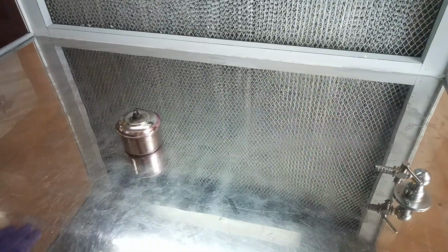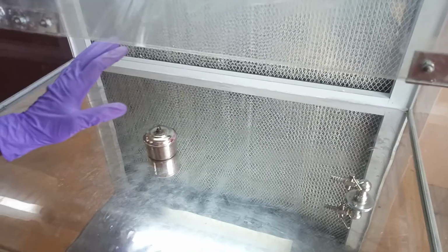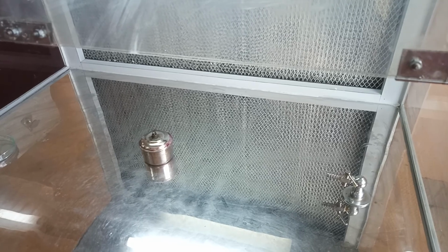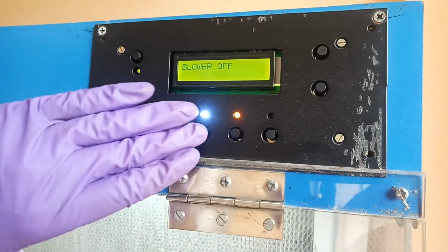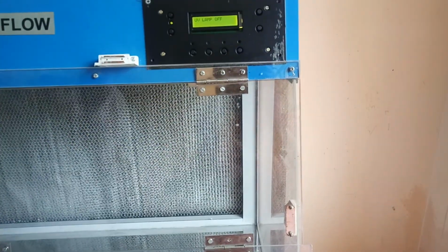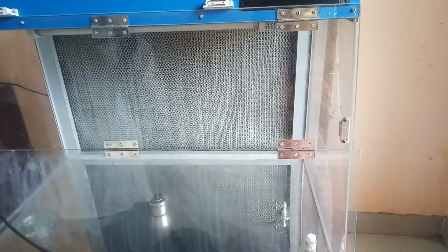After we are done with our work, we again close it down, and if there is a possibility of microorganisms being present over there, we switch off the blower and fluorescent light, and switch on the UV once again, so that all microorganisms that might have been present after we have carried out our work will get killed. Then at the end we switch off the UV and the job in the laminar airflow is done. So that's all about the functioning of laminar airflow.